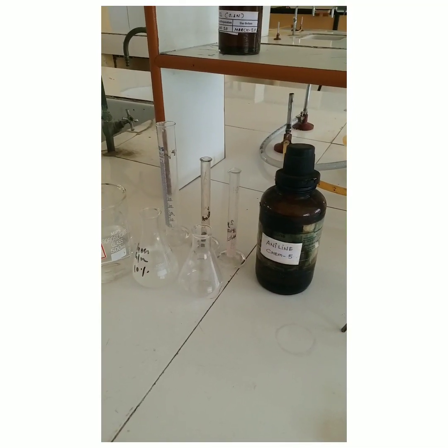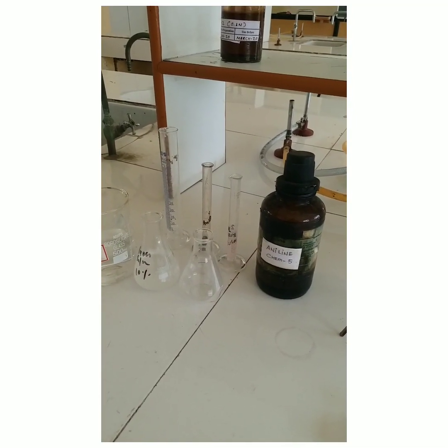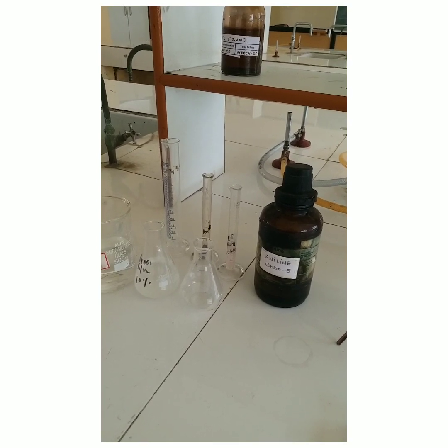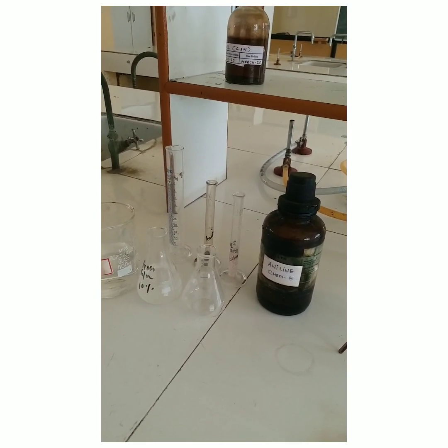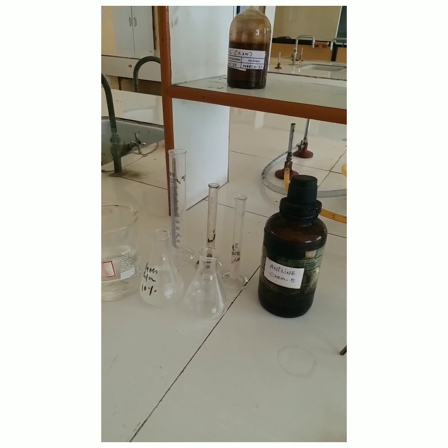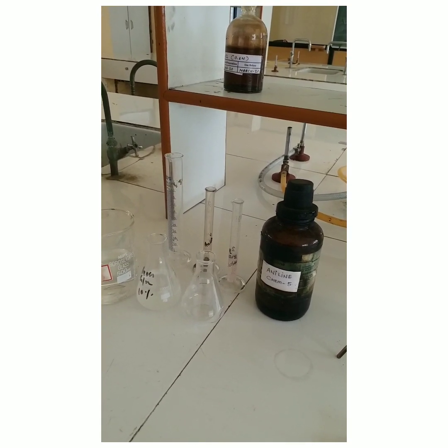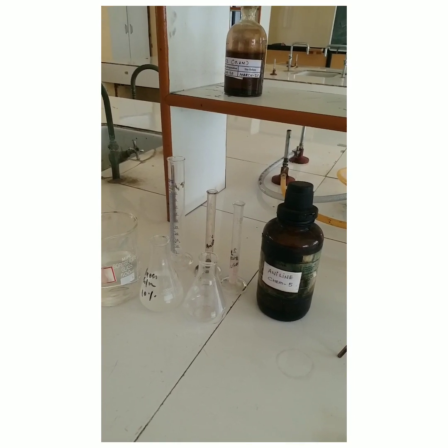In pharmaceutical organic chemistry, today we are going to perform experiment number 5: synthesis, purification, characterization, and percentage yield calculation of benzanilide from aniline.